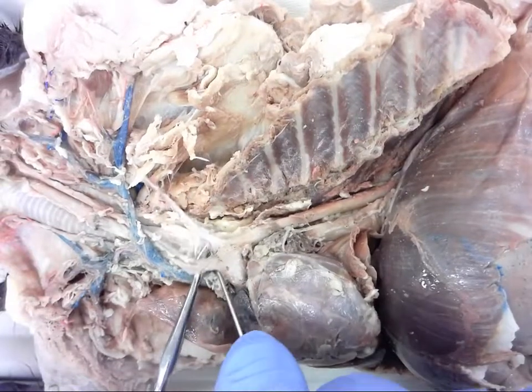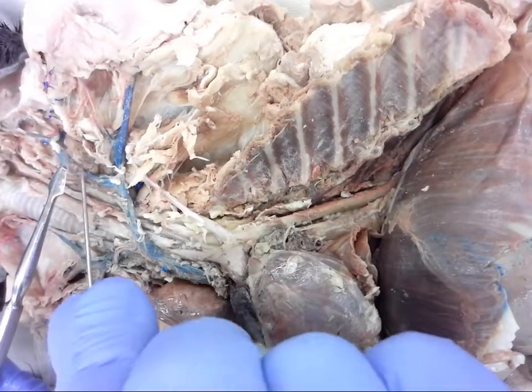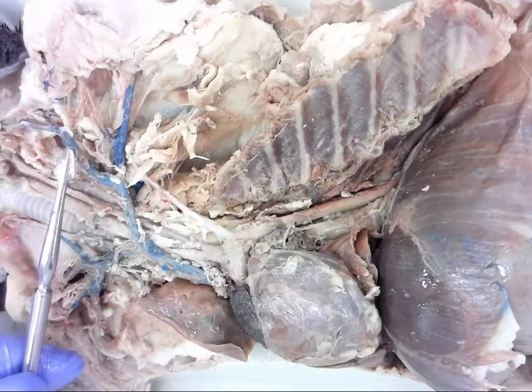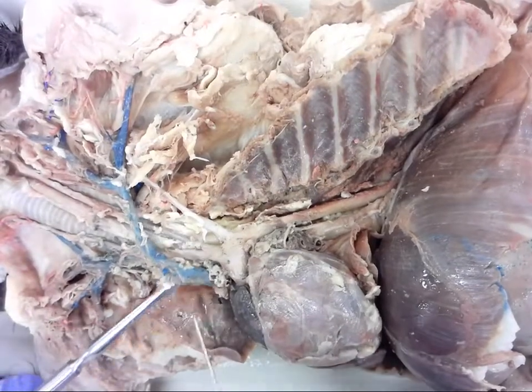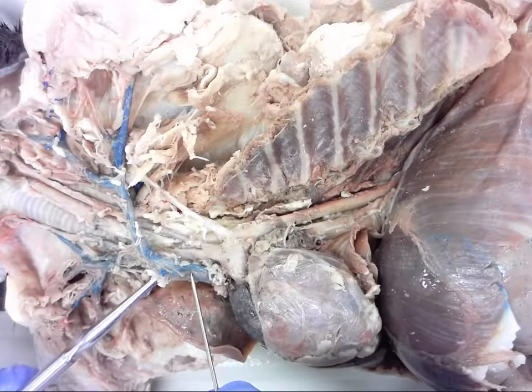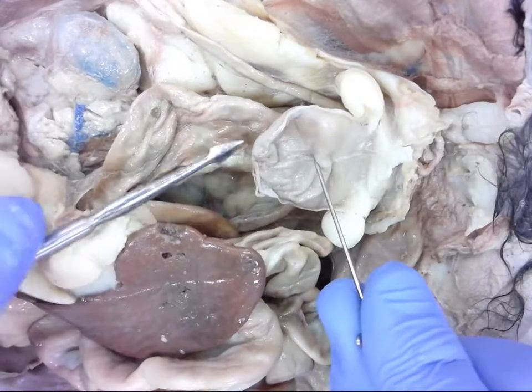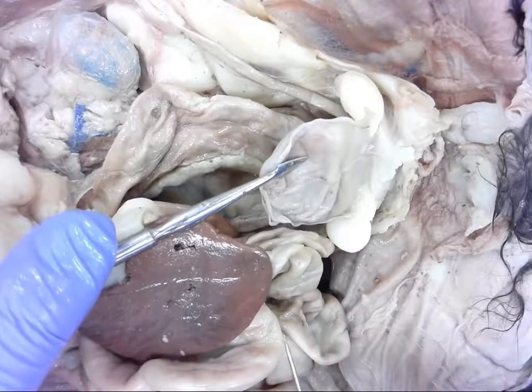Number twelve — I'll get a little bit higher up. This is right here. Number thirteen — you hear our passing music, which means I need to move along. This is number thirteen. Move down here to number fourteen. Once again, review — check your description for answers. I hope we did well here.